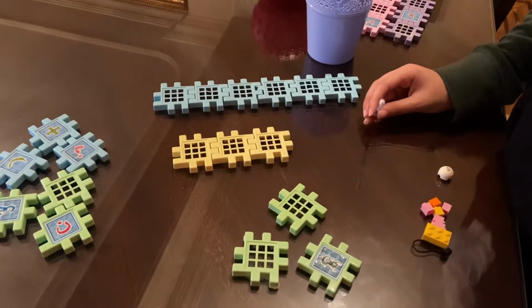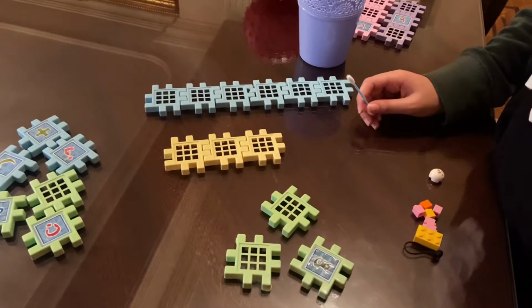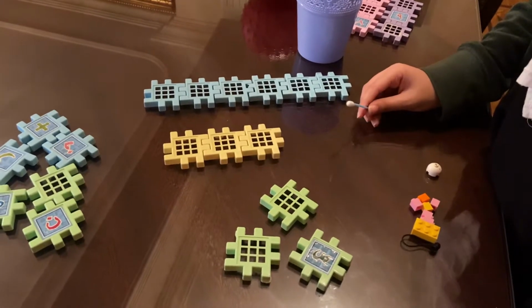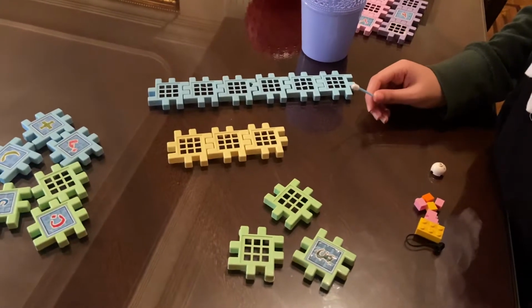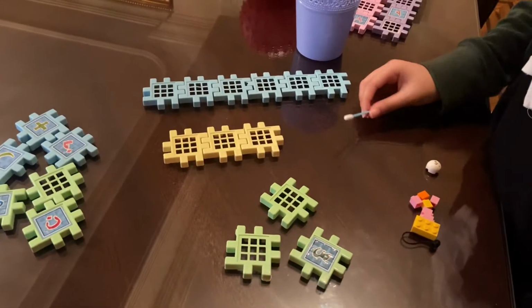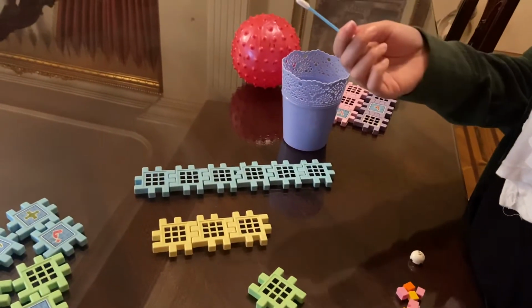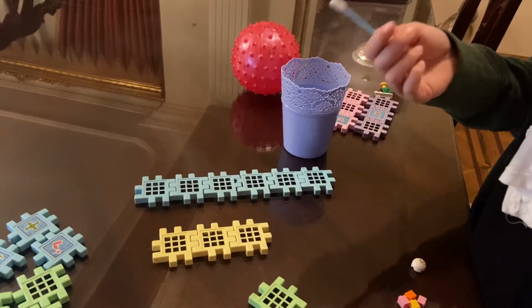Hi, my name is Nada Mustafa, and this is a 3D model of reverse transcriptase PCR, in which DNA is made by reverse transcribing RNA, and then it is used to test for the COVID-19 virus. So firstly, there will be a nasopharyngeal swab done collecting a sample from the patient.